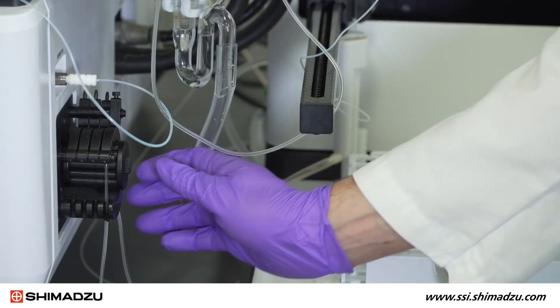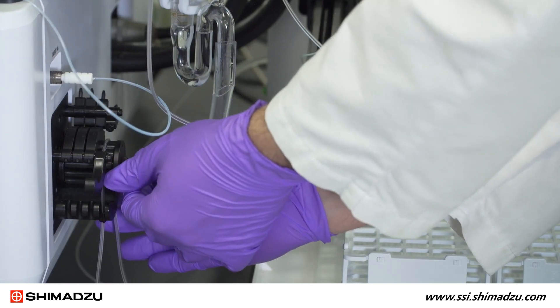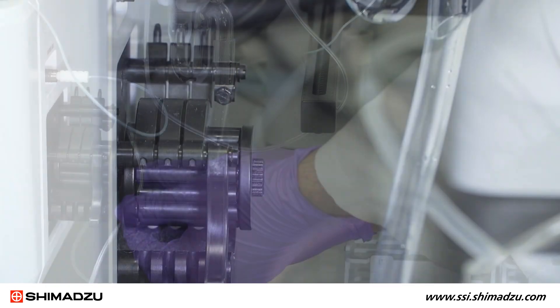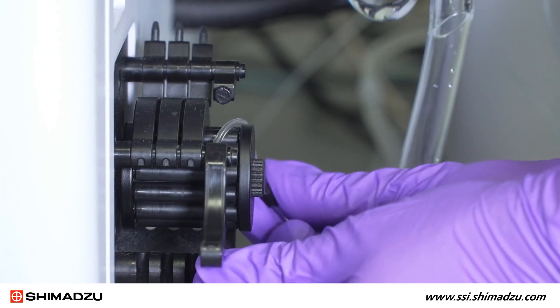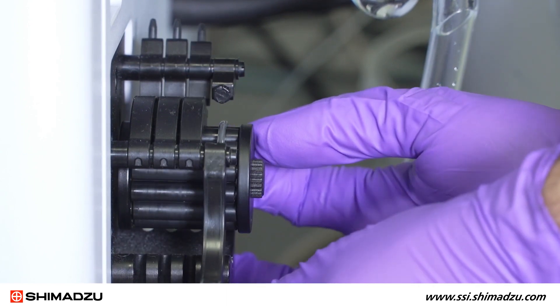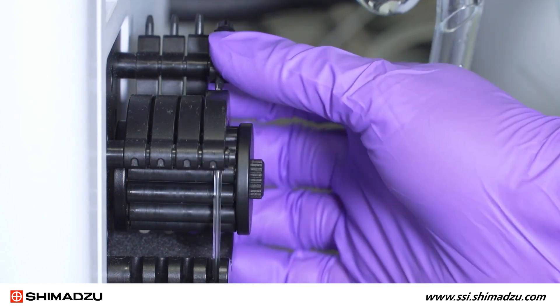The peristaltic pump tubing can become worn with extensive use and should be visually inspected daily. Worn peristaltic pump tubing should be replaced. As you replace the new tubing, make sure to verify that it is centered under the clamp. The tension of the peristaltic pump on the tubing must be checked and optimized to ensure the most even liquid flow.